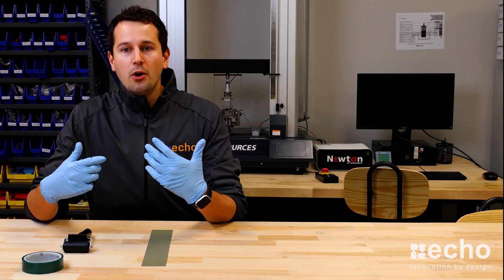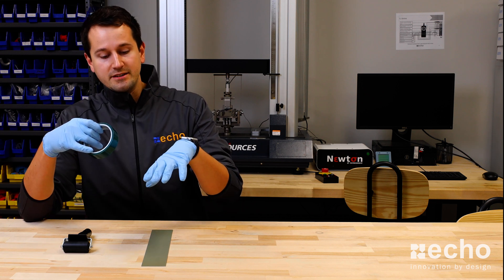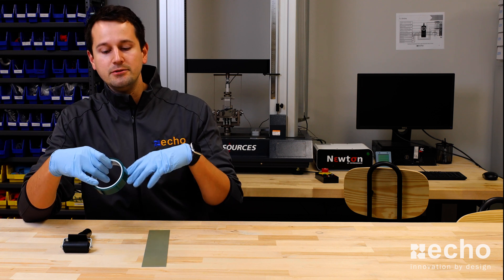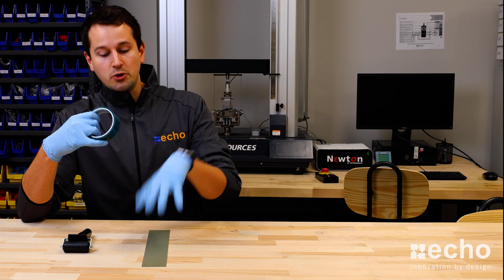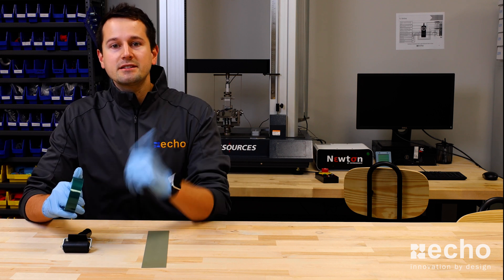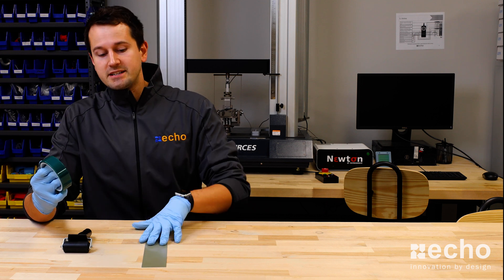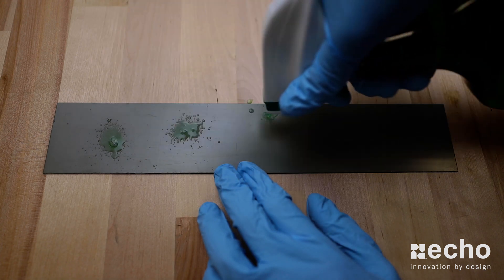So today what I wanted to do is demonstrate the difference between room temperature tape, which is ideal for adhesion, as well as a room temperature or warmer metal surface, and compare that to tape that would have been kept in more of a wintery condition as well as a colder metal surface. To demonstrate this, we're going to use this 90-degree peel test machine and we're going to use one-inch green poly on the exact same metal substrate for each test.